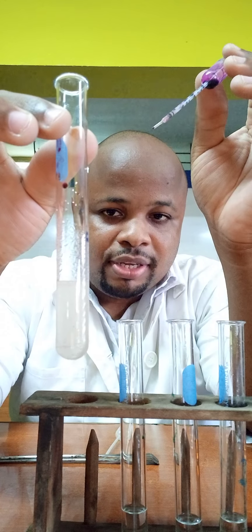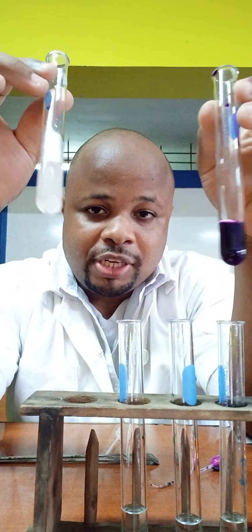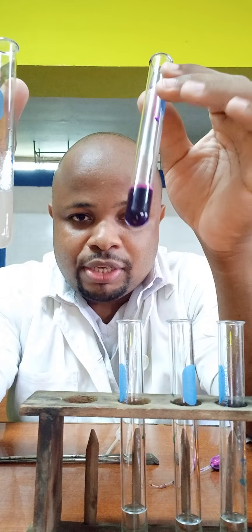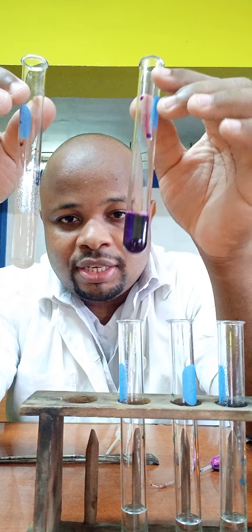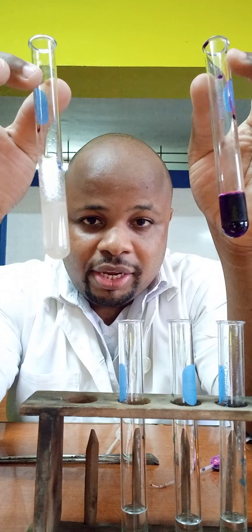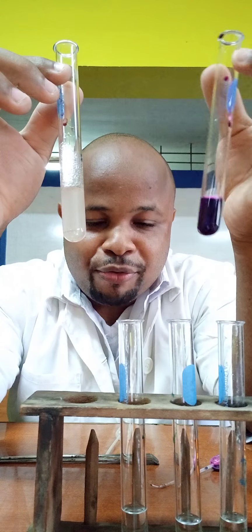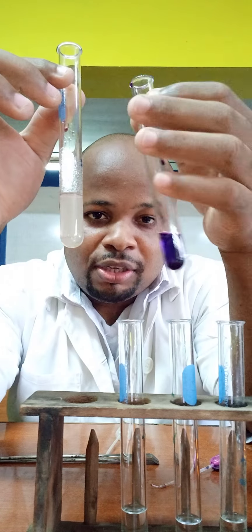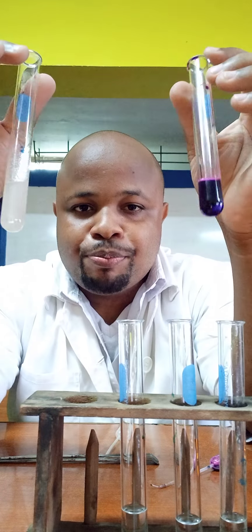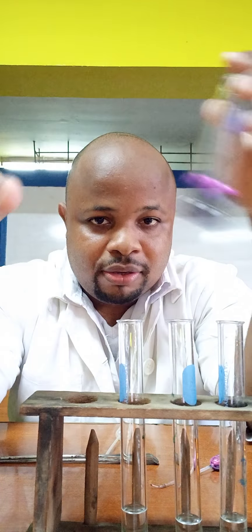Liquid A did not stay purple — it changed from purple to colorless. Liquid B, when you add the potassium permanganate, it is still purple. But liquid A became colorless. We know the reactions of alcohols and carboxylic acids, so we should understand why this happened. So the first reaction: potassium permanganate — purple for liquid B, colorless for liquid A.